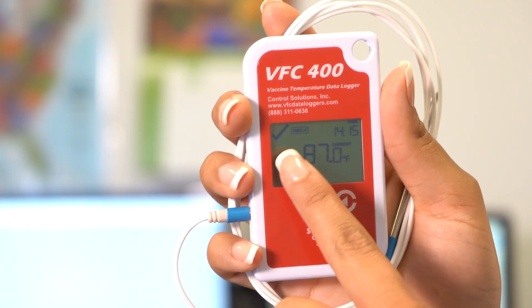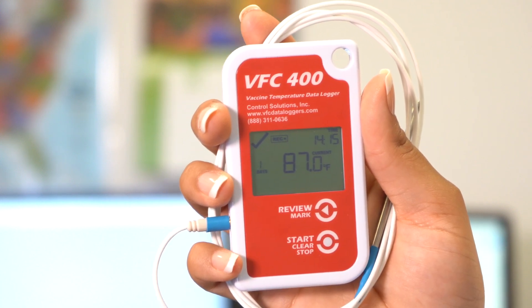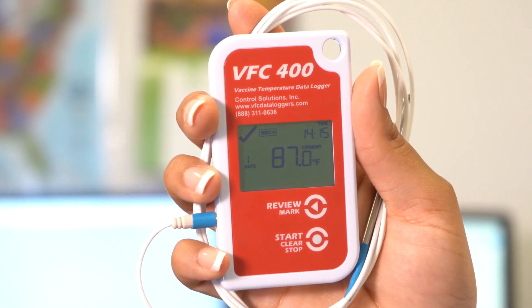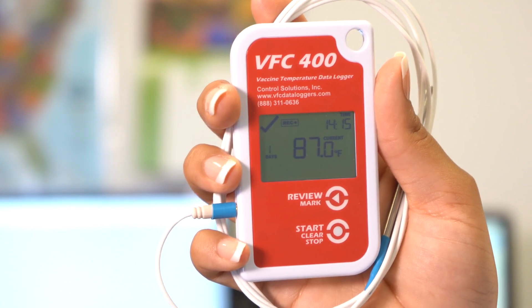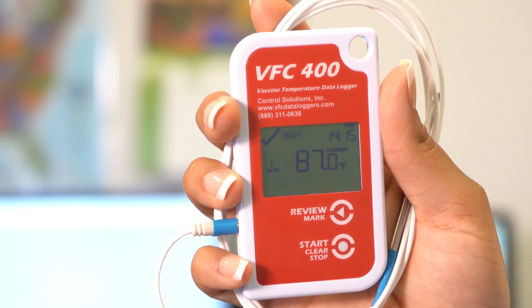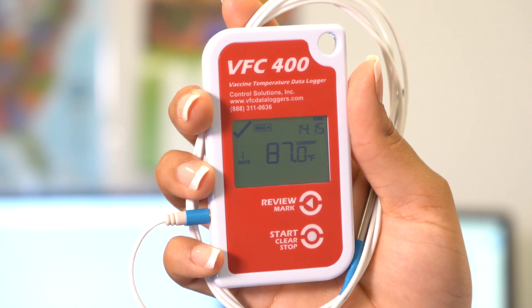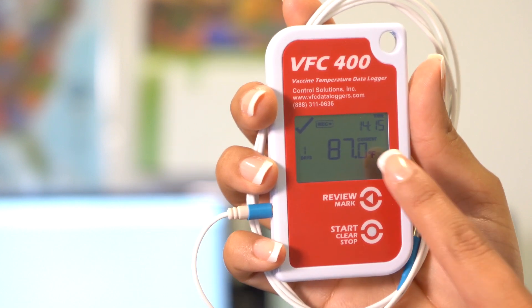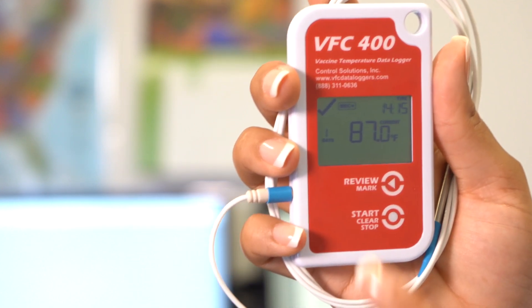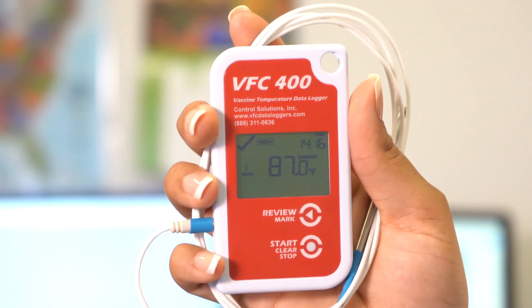Here are a few things you'll see on the screen of the VFC 400. Up at the corner, you will see a check mark, which means that the temperature is currently within range. If the temperature is out of range, you will see an X mark and you will also hear a beeping noise. REC means that the data logger is currently recording. You also have your current time, how many days you have been recording, and your current temperature.